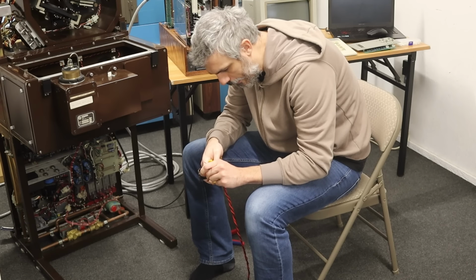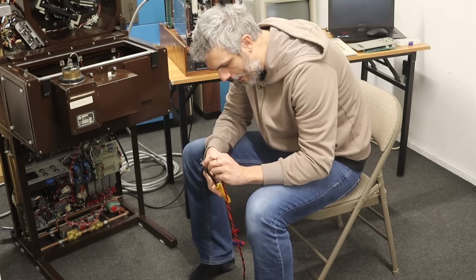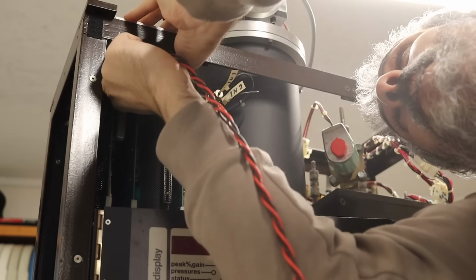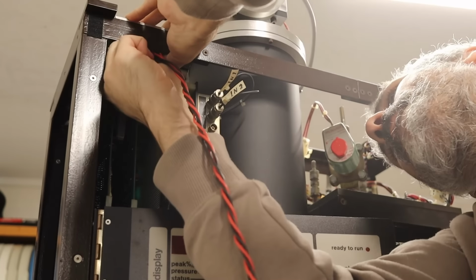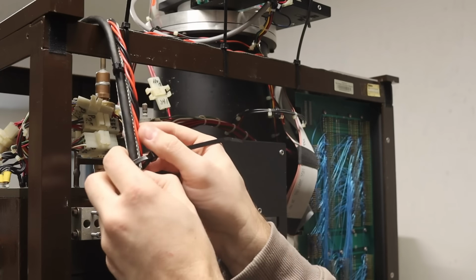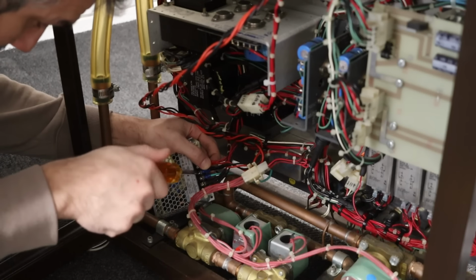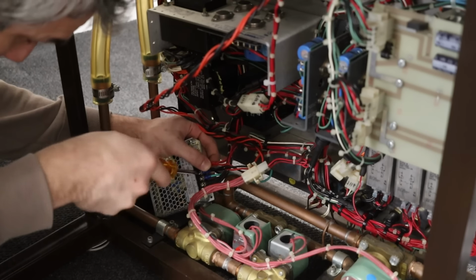Next, I'll strip and add connectors, and later I added in a plug to make removal a little easier, but I was too impatient to do that just now. I'll plug it into the communication board up top, then spend some time routing it neatly along the back, and down to the power supply below. Since we replaced the PSU that was originally meant for this, I'll just screw these into the replacement Meanwell supply that's in there.